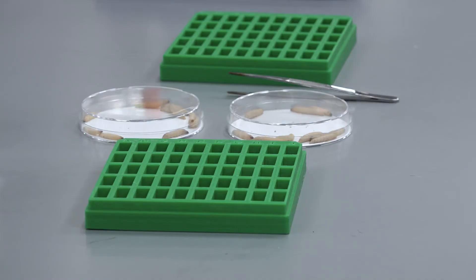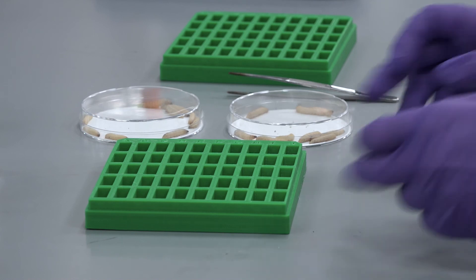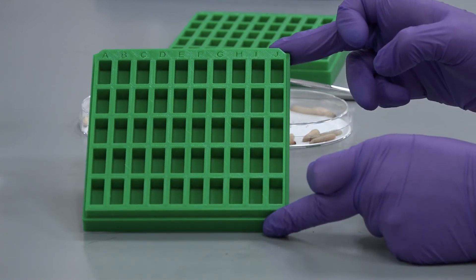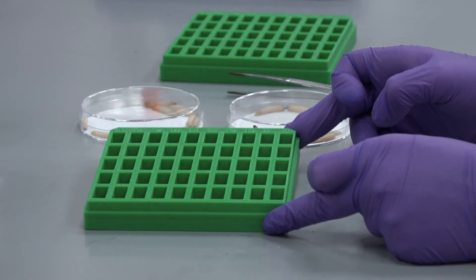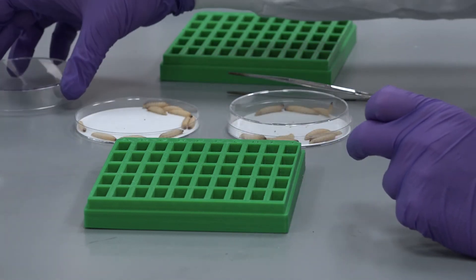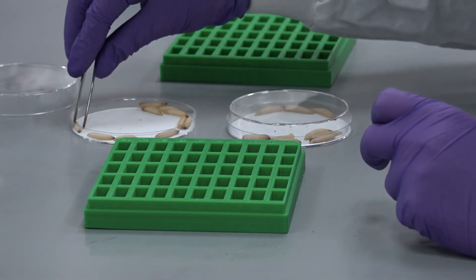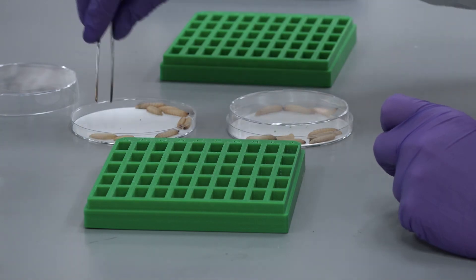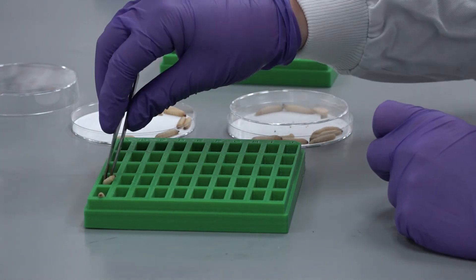The larvae are alive for imaging, so we have designed a bespoke plate that helps to reduce larvae movement when imaging. These plates hold 50 larvae and allow you to monitor the bioluminescence and health of individual larvae over a given time course.